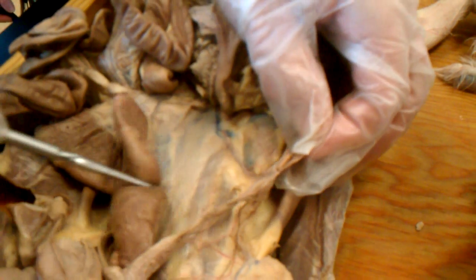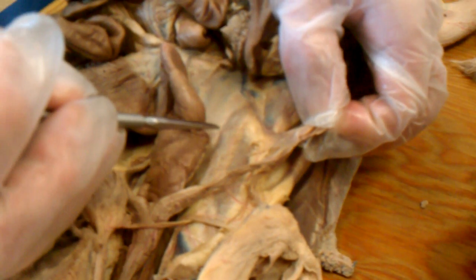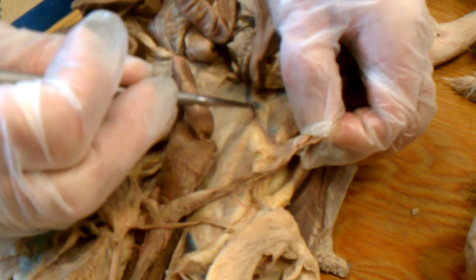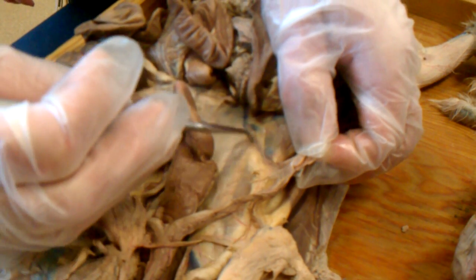And the uterine blood vessels, the ovarian blood vessels, branch from the same place they would have in a male, although a little atypical on this cat. One little branch is coming along like that, and the major branch is actually branching off the renal artery to go out to the ovary, and then a vein comes back again.